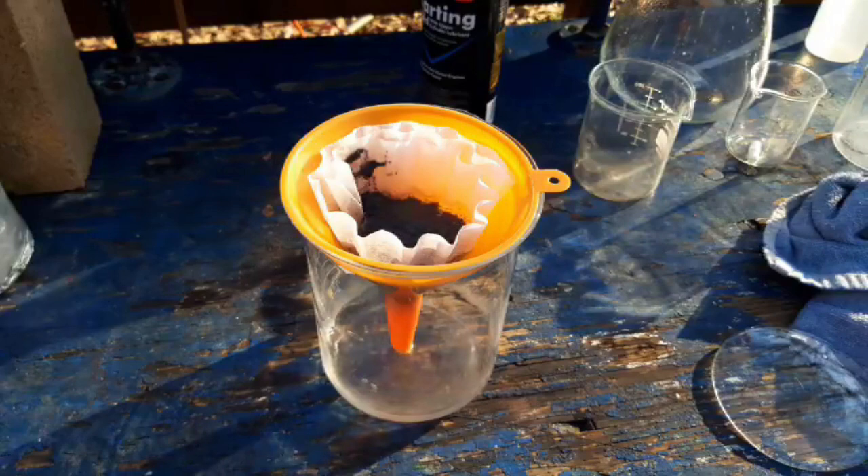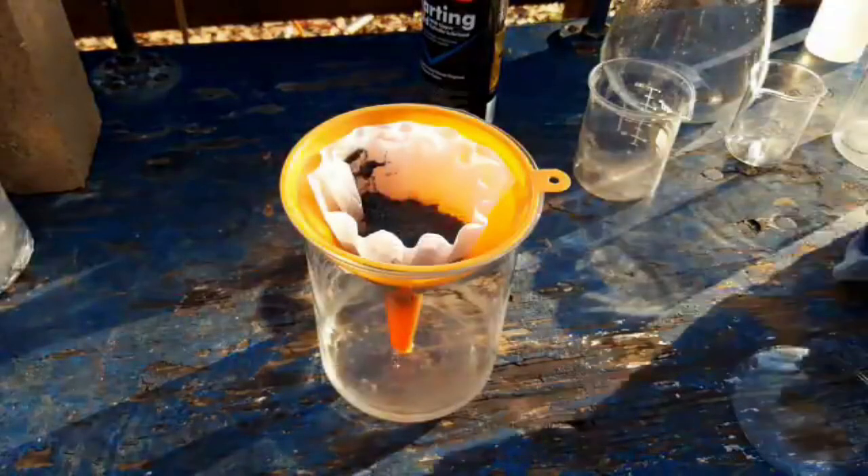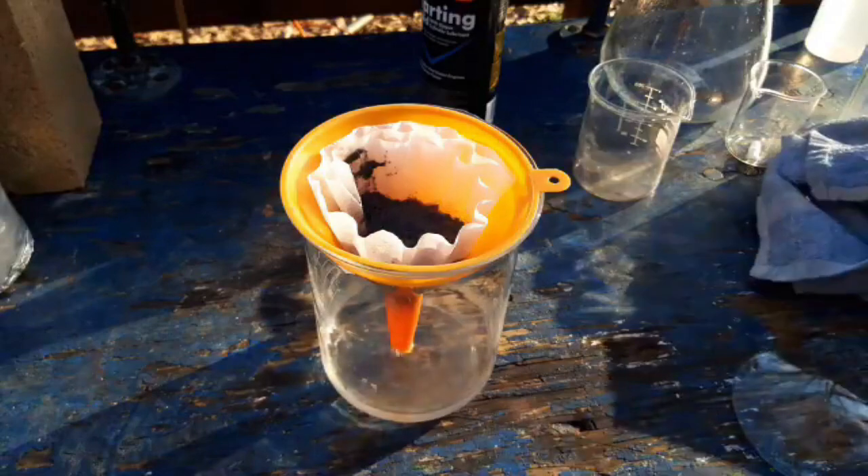Where's my thing here? There's the thing — wet and contaminated, exactly not as I need it to be.